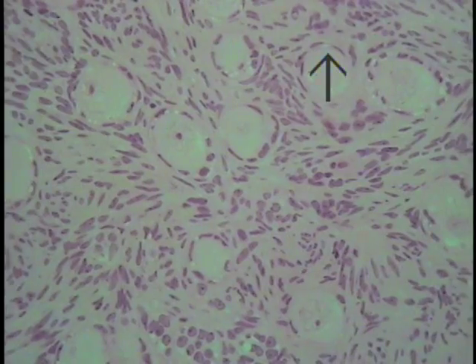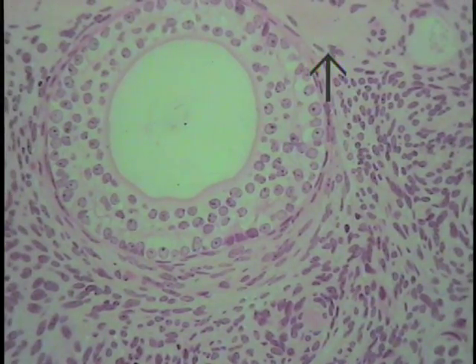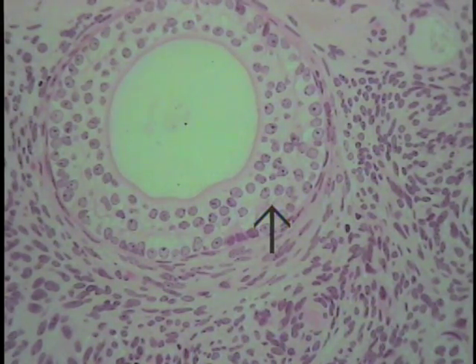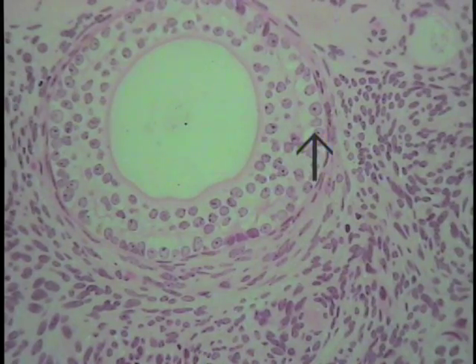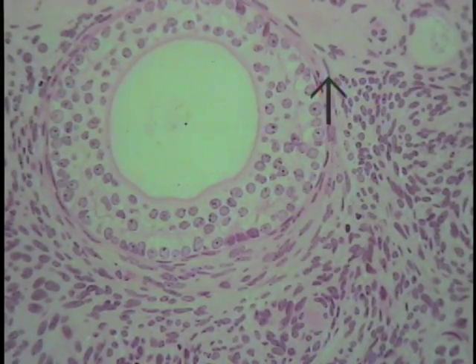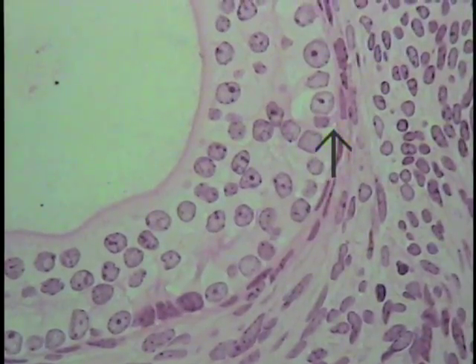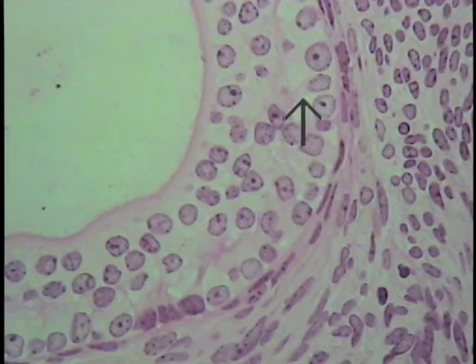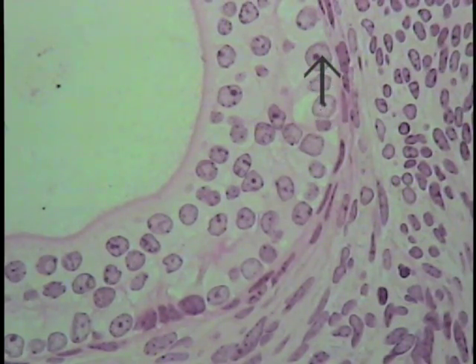Now having made those observations, move the field on your particular section and look at yet smaller cells. This band of structures here, as indicated by the pointer, is a collection of several cells. The nuclei can be made out quite clearly, as well as on occasion the nucleolus, as shown here and here. At increased magnification, identify the nucleus, the boundary of the cytoplasm, and nucleoli if they are present.